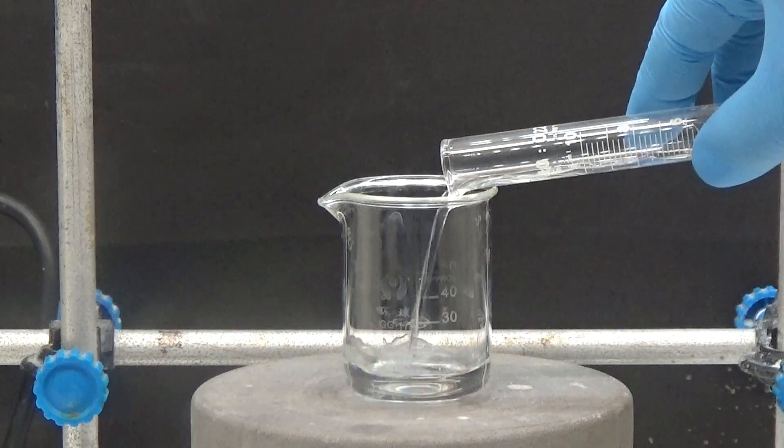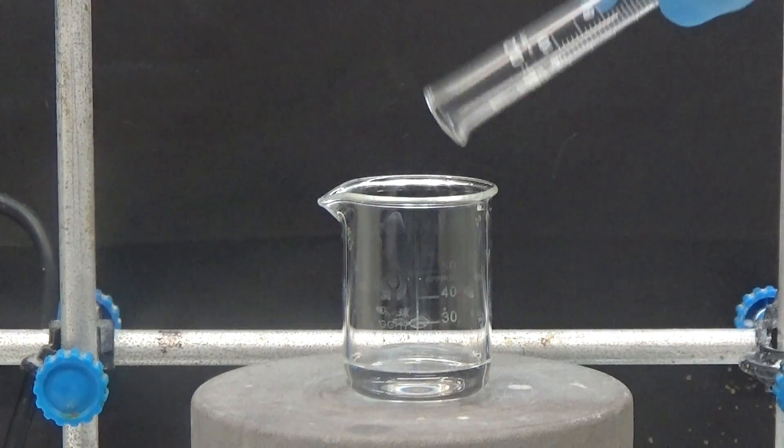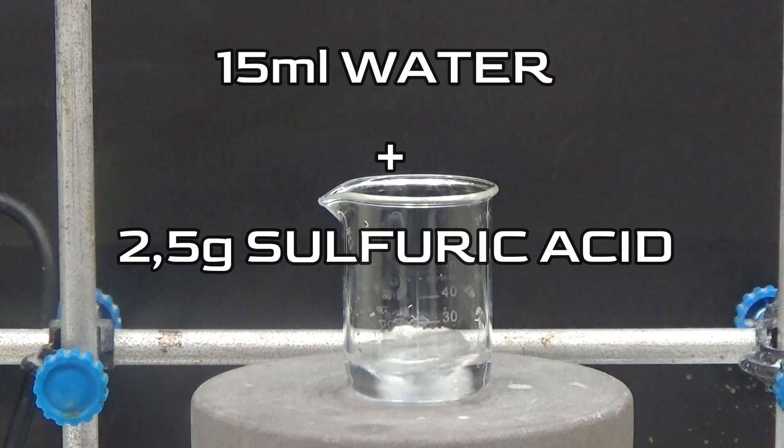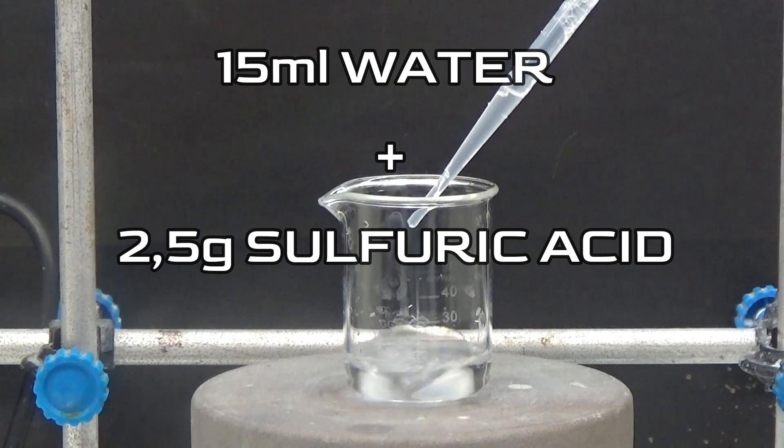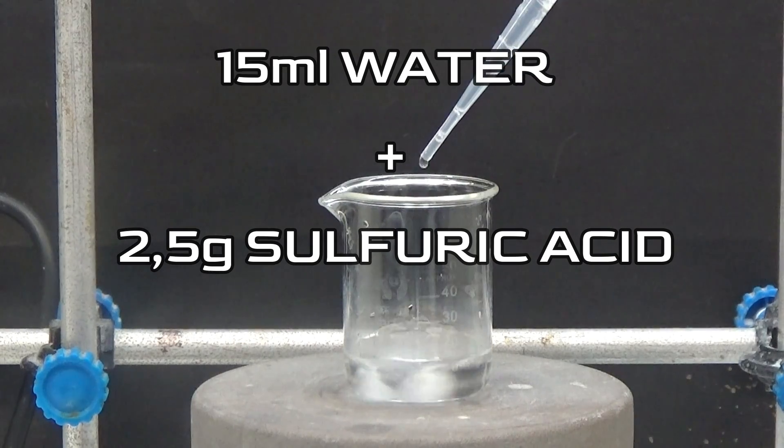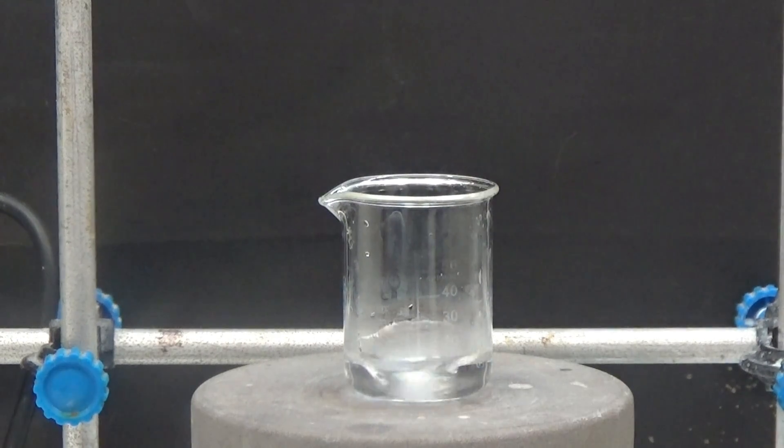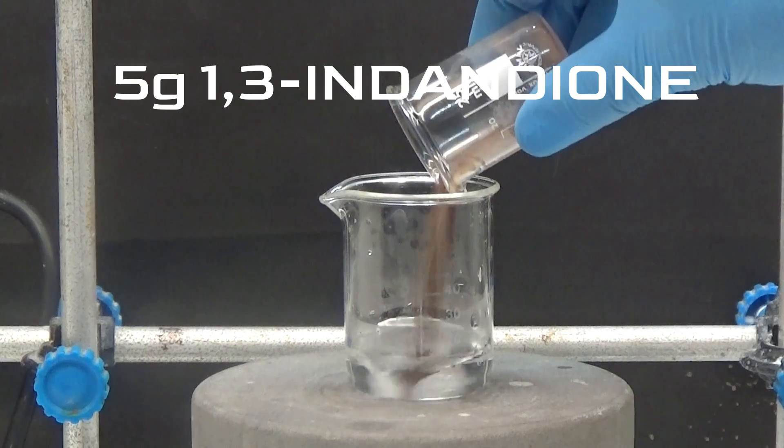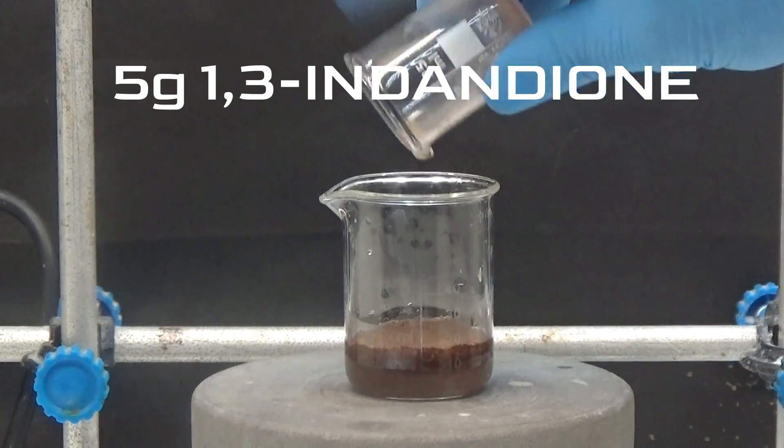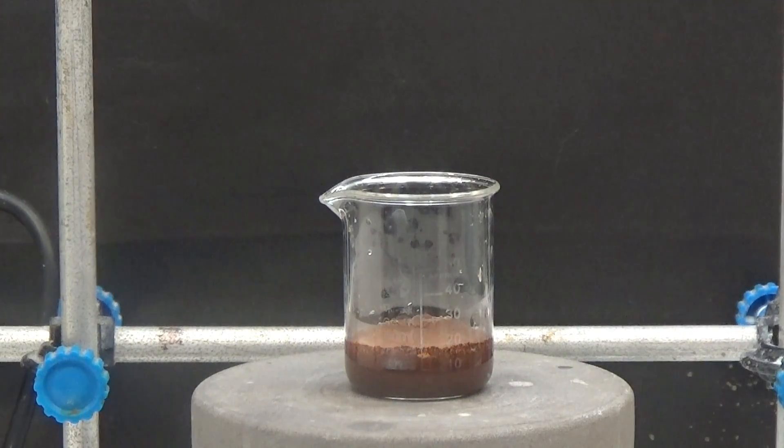In the first part of this experiment, we will use a 50 ml beaker. Put 15 ml of water and slowly add, with stirring, 2.5 grams of concentrated sulfuric acid. We let it cool and add 5 grams of 1,3-indanedione all at once. Leave to stir for 30 minutes.